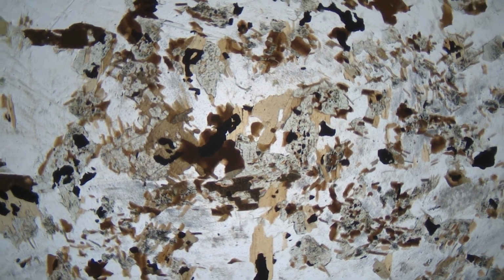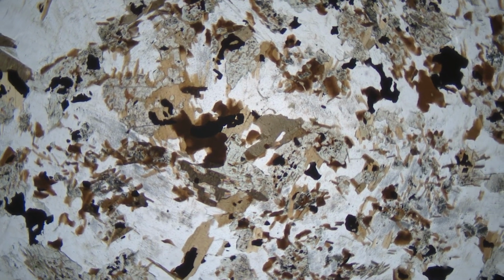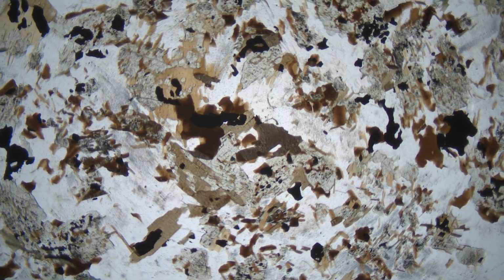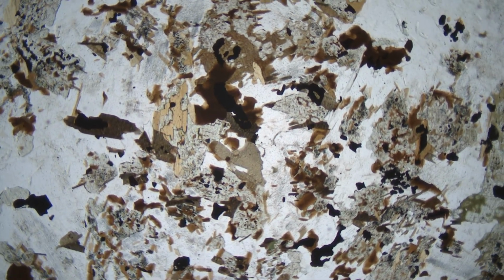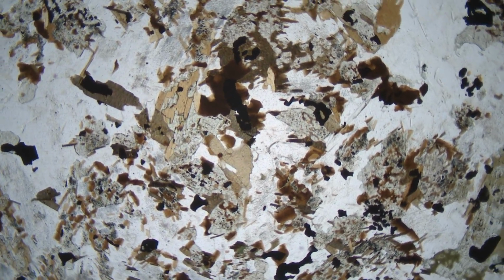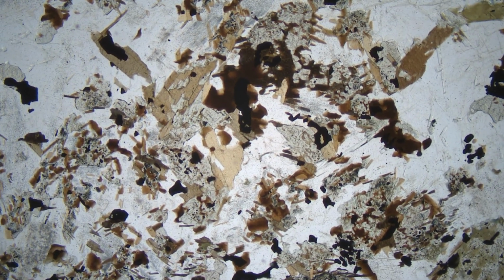Here is a view of a thin section in plane polarized light. The brown material is biotite in various shades of brown that change if we rotate the stage, and the green material is mostly hornblende. The opaque material, the black grains, are primarily magnetite. And the clear grains could be feldspars or quartz. In this view, identifying the biotite and the hornblende is straightforward, even if we might not have been able to see them in hand specimen. We cannot, however, identify the clear mineral grains with any certainty.